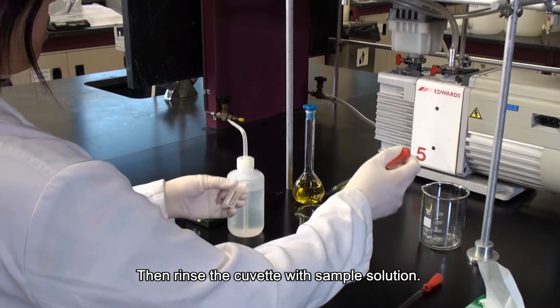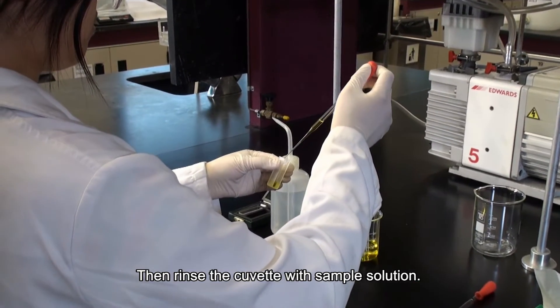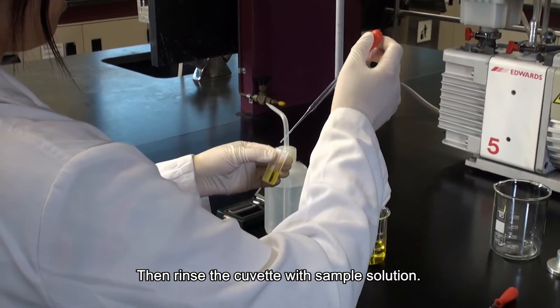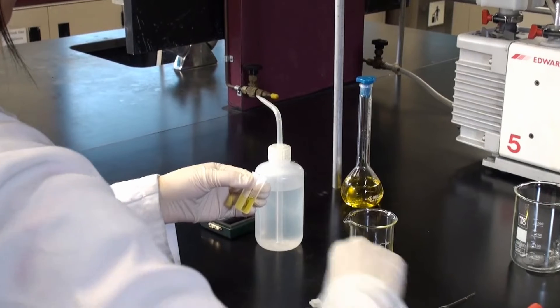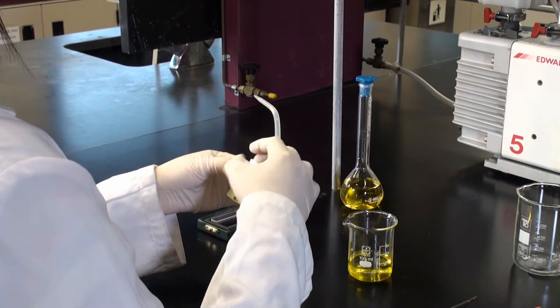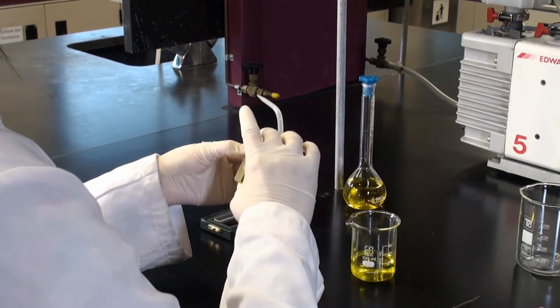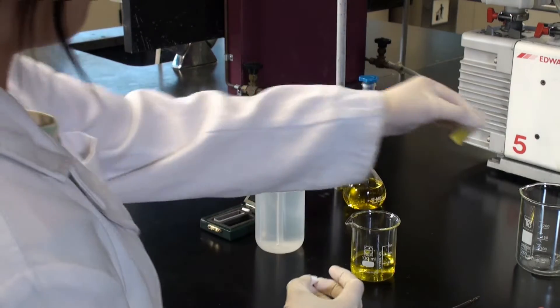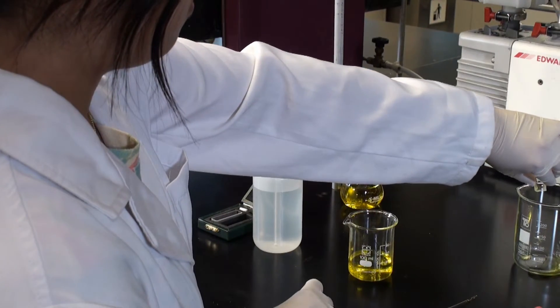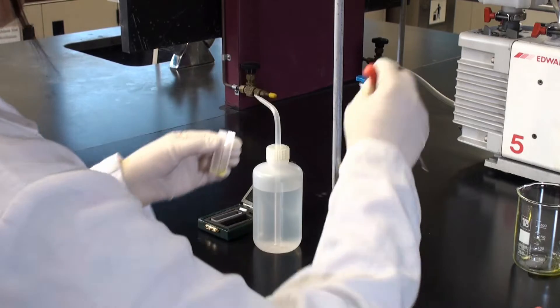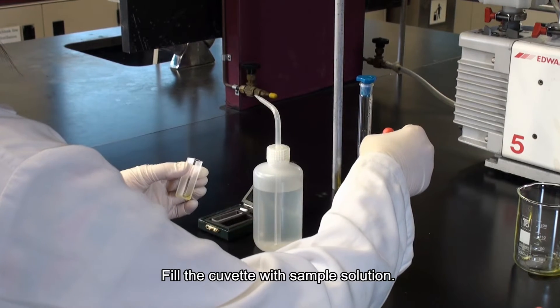Then rinse the cuvette with sample solution. Fill the cuvette with sample solution.